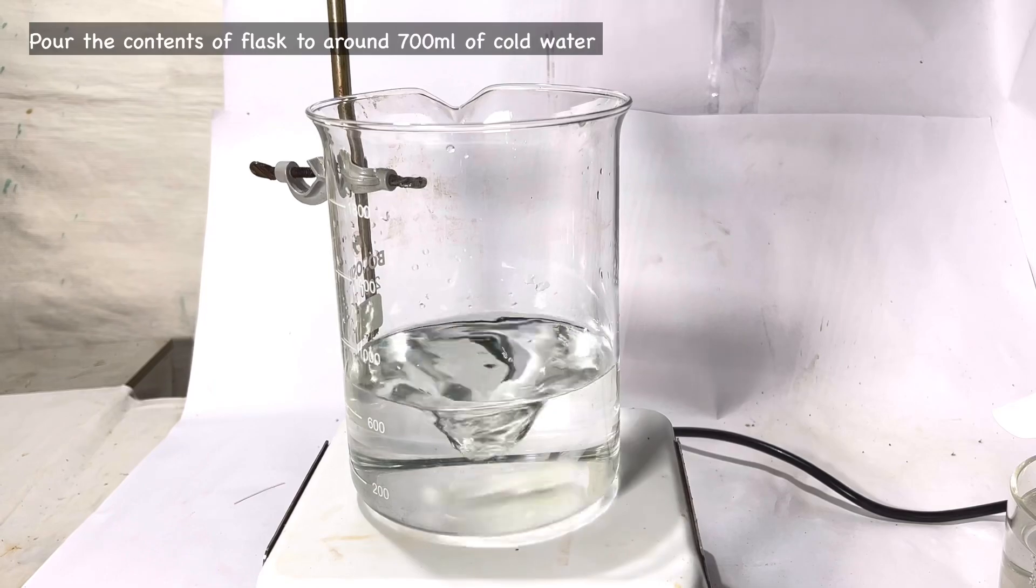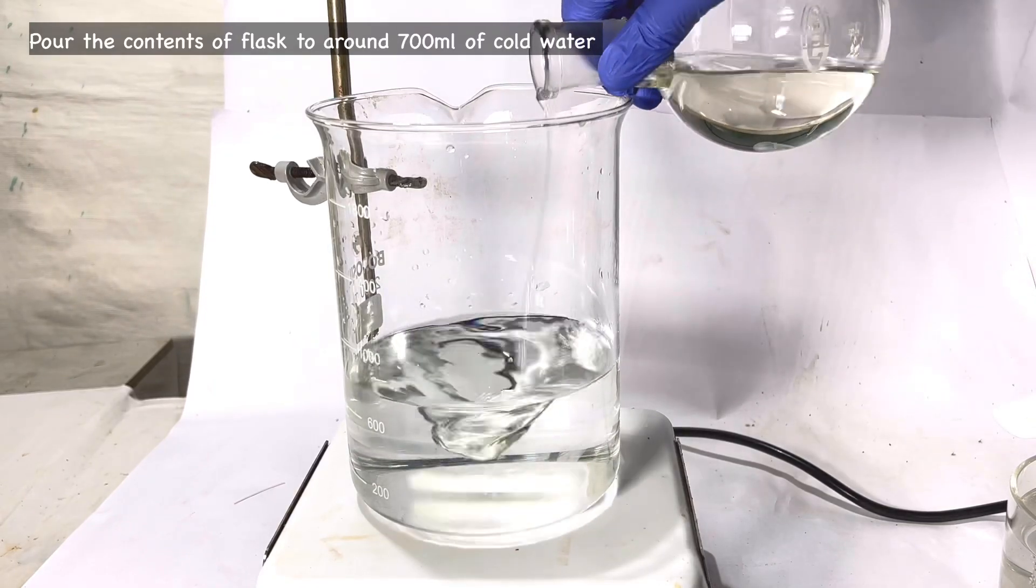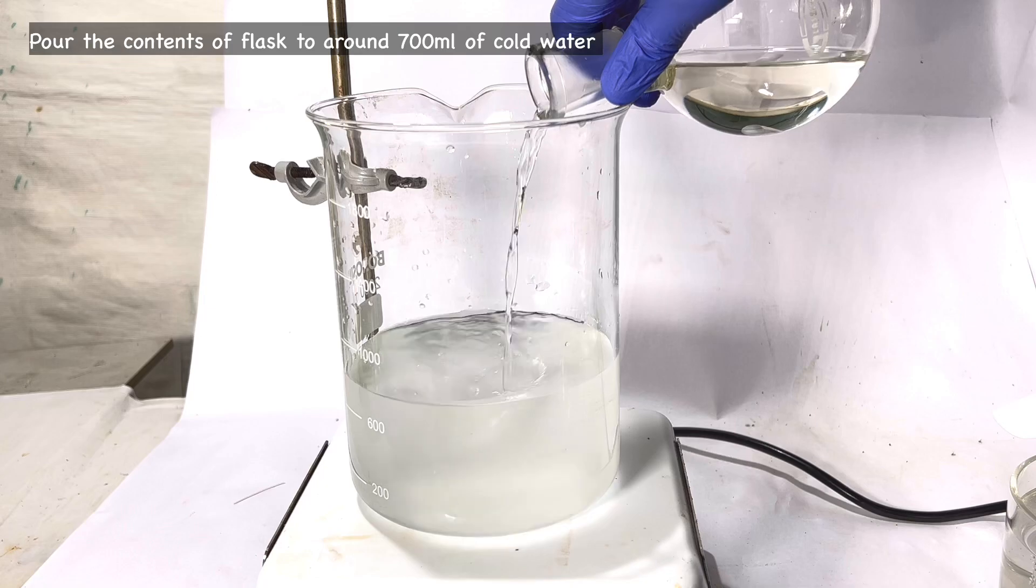After four hours, the contents of the flask were poured into around 700 milliliters of ice-cold distilled water with constant stirring.